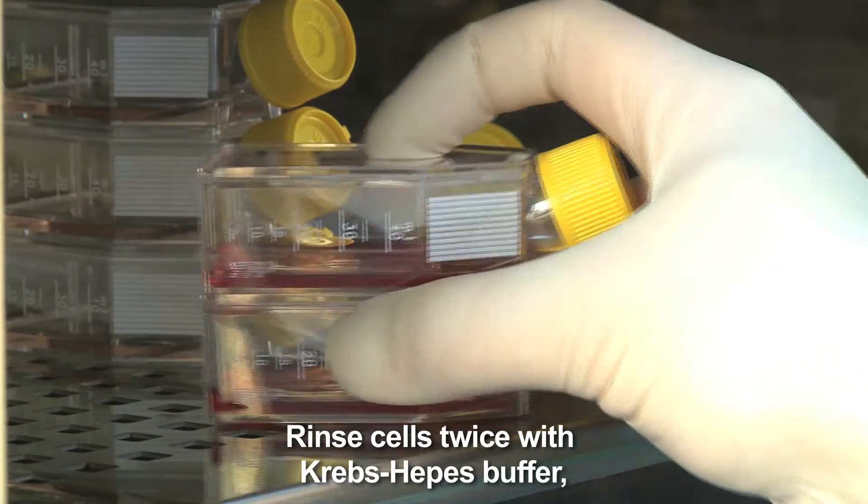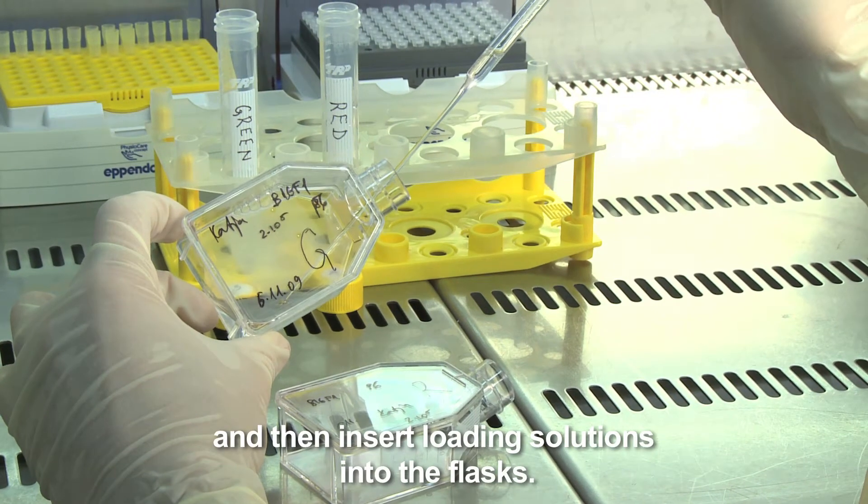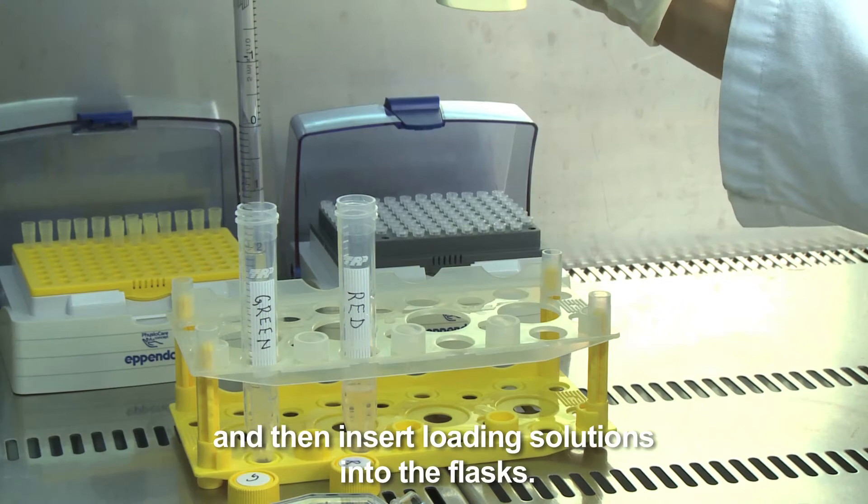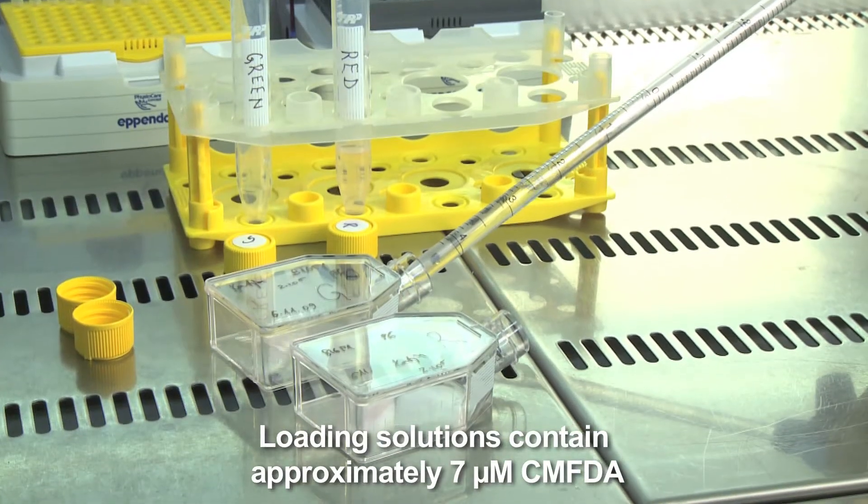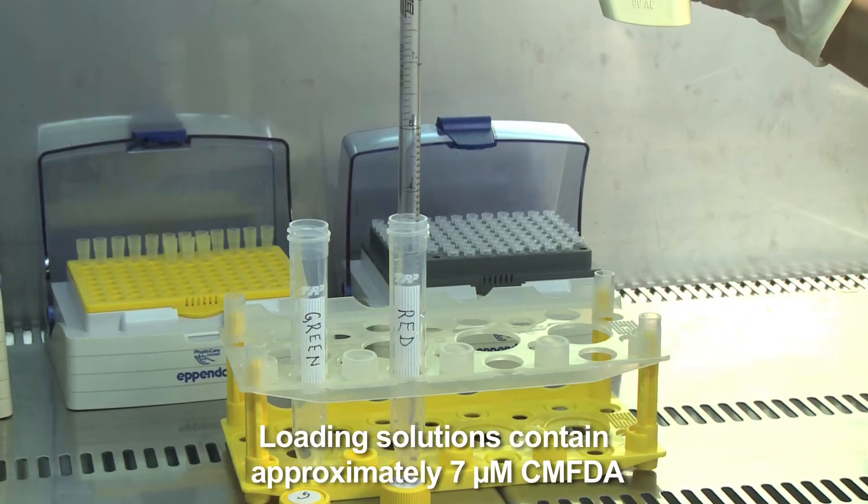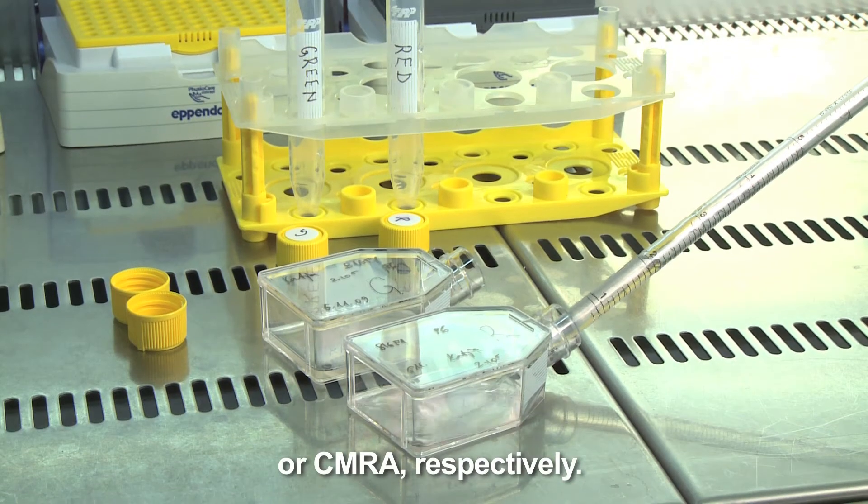Rinse cells twice with Krebs-Hepes buffer and then insert loading solutions into the flasks. Loading solutions contain approximately 7 micromolar CMFDA or CMRA respectively.